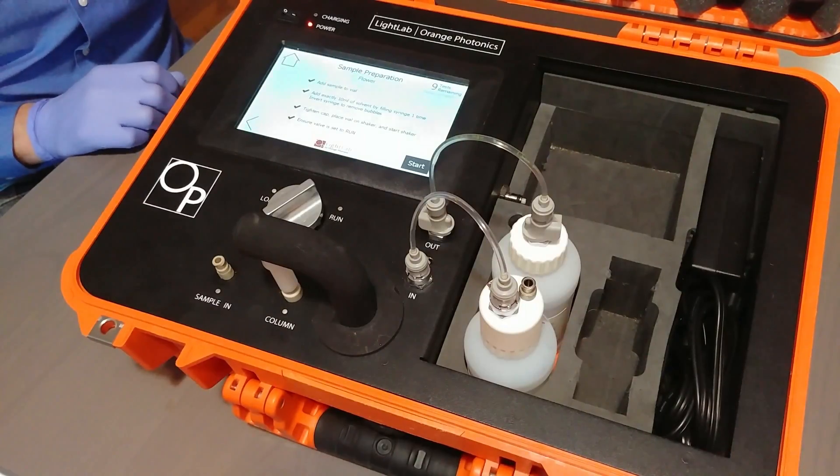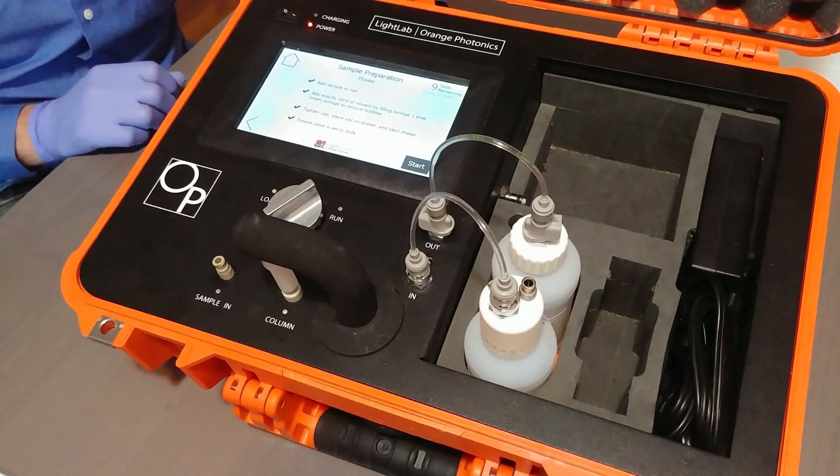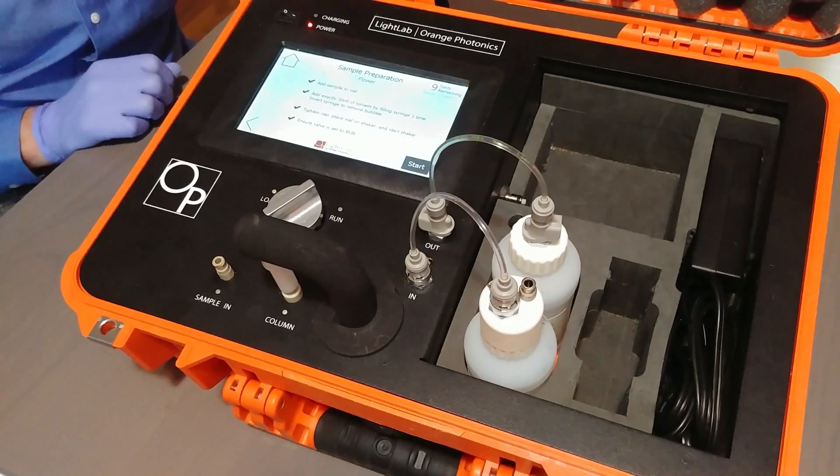Once the vial is on the shaker you'll be prompted to hit a start button which will begin the process of preparing the instrument for analysis.